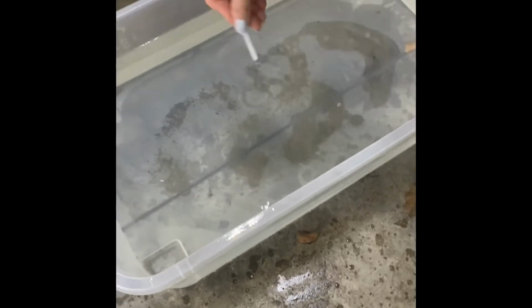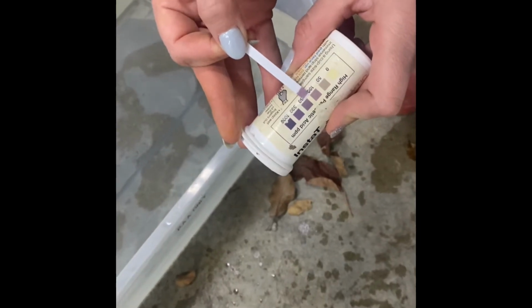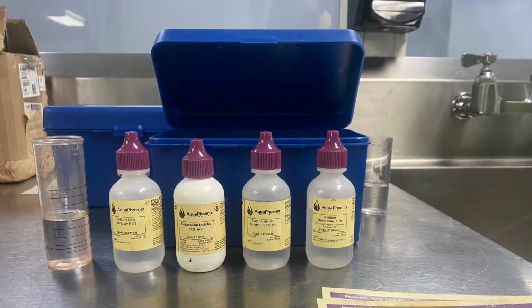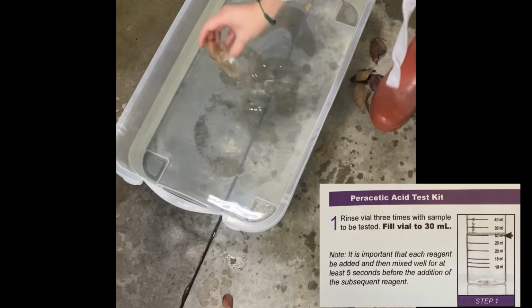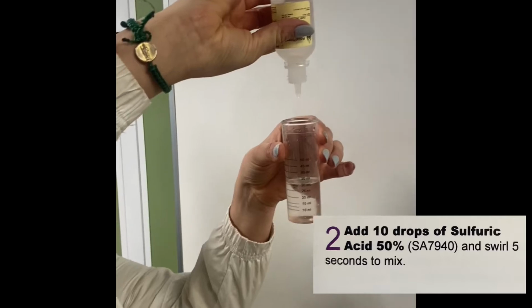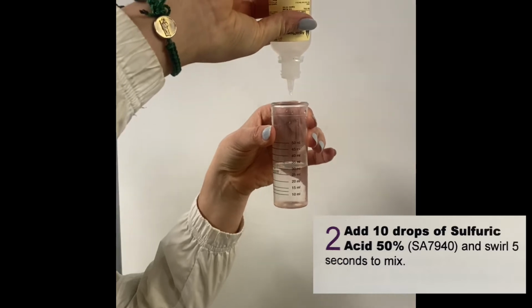After filling this up, I do the test strip and I see that it's between 100 and 150. I'm not quite sure, so I'm going to get my titration kit out again. Step 2, add 10 drops of the sulfuric acid, 50%, and swirl for 5 seconds to mix.